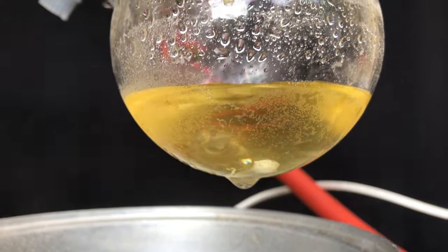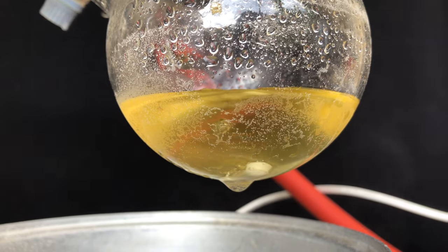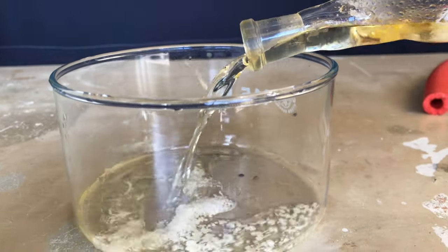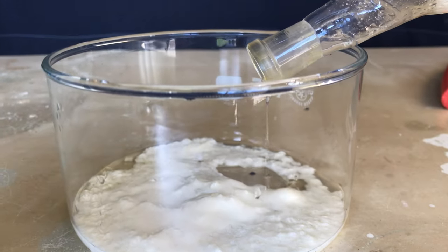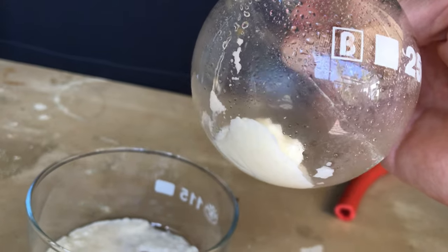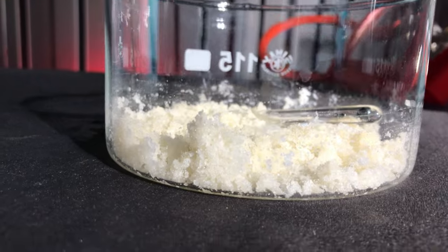In the end it looked like this and if I had to do this all over again I would just boil it off in a crystallizing dish followed by drying it in a vacuum chamber. I let the flask stand for 2 days and nothing solidified and I first thought that I somehow destroyed the product. But after it was transferred to a crystallizing dish it instantly crashed out and it was beautiful to watch.